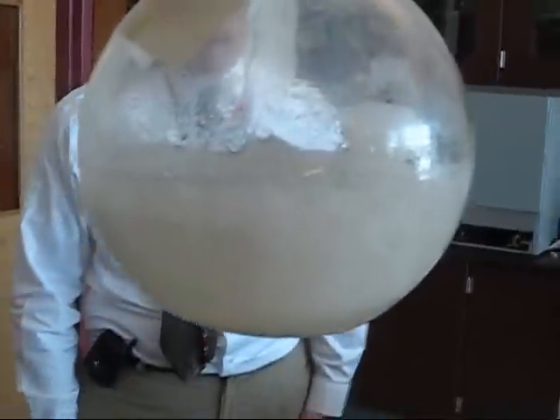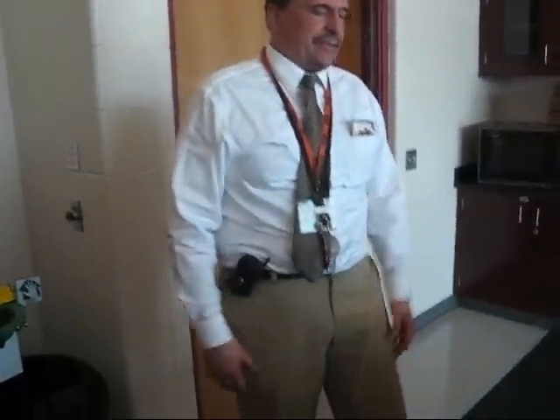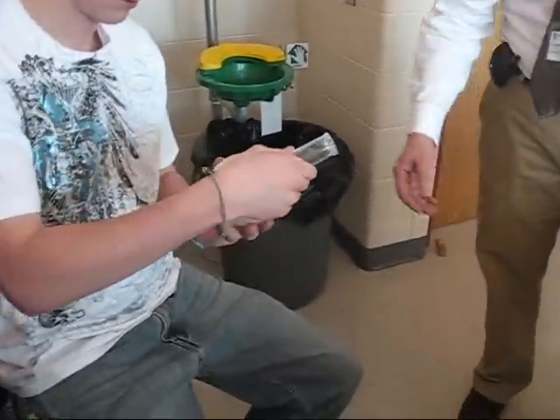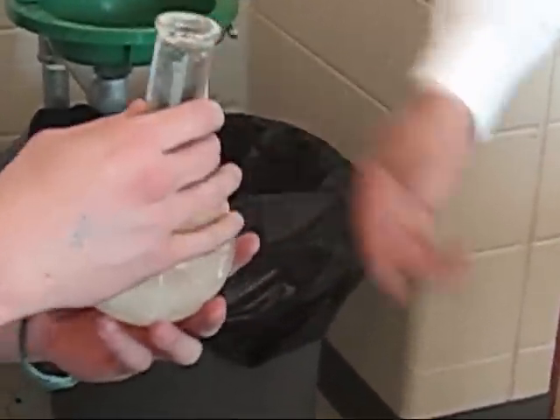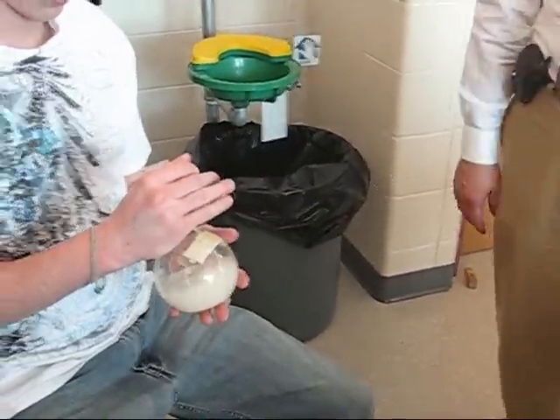Is it a solid thing — like, turn it upside down? Yeah, be a little careful. It's all like trapped — everything gets strapped. It went from like direct... it should get warm. Yeah, you can smell it. You don't have to worry about water. Does it feel warm, Seth? Yeah. Warm puppy? Yeah, you can see the solution and stuff — a little bit in that one, at the top. If you dumped it, it would make a little crystal spot. Make a warm puppy.